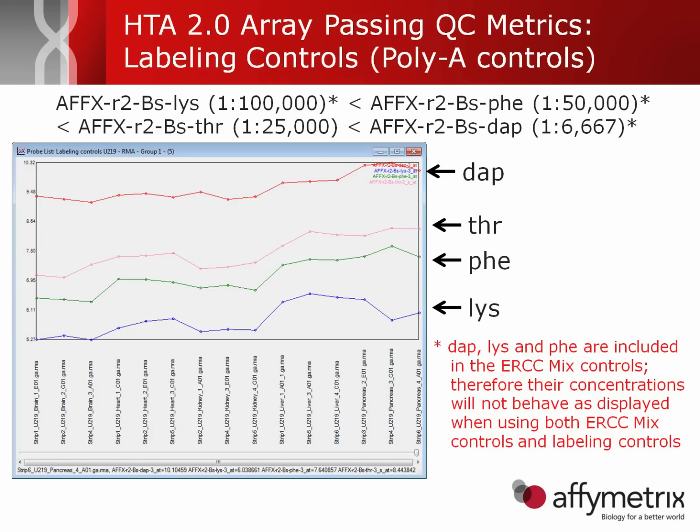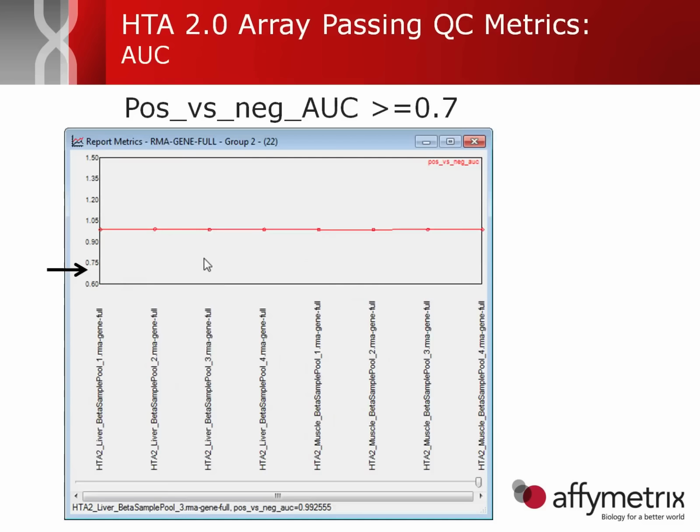Because Dap is expected to be the highest, even if you add more Dap by the ERCC controls, it is still greater than all the rest of them. But Thr and Lys have become mixed up, and so that is a problem when you're evaluating both. This can be seen in the demo data or the sample data that's provided on the Affymetrix.com website.